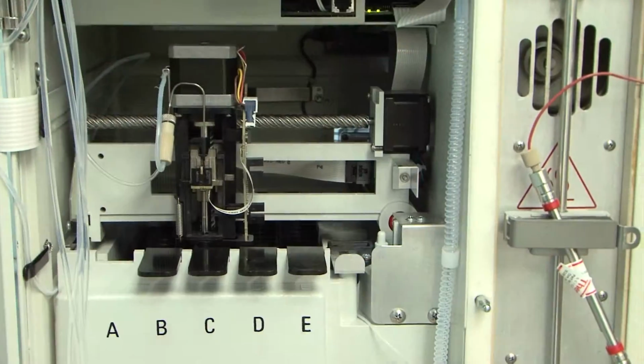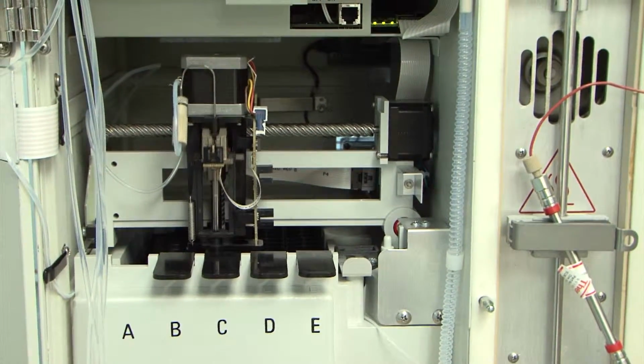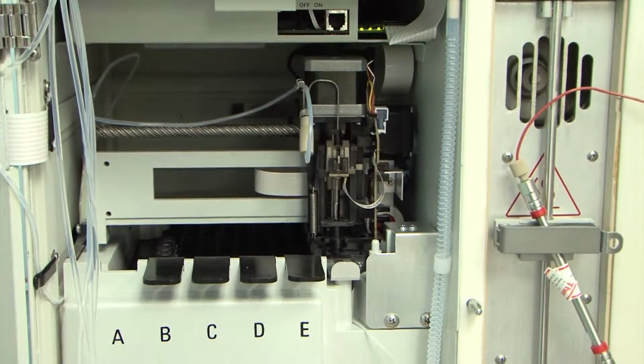This is the analytical instrumentation that we're going to be using to detect the pesticides and red tide toxin that's going to be separated by this filtration apparatus. So this is an HPLC mass spec. What we do is we actually introduce the sample into this instrument, and it gives us a signal when we get a detection of that particular pesticide.